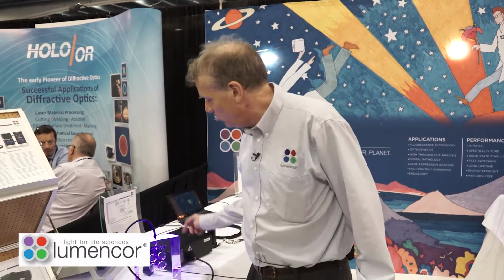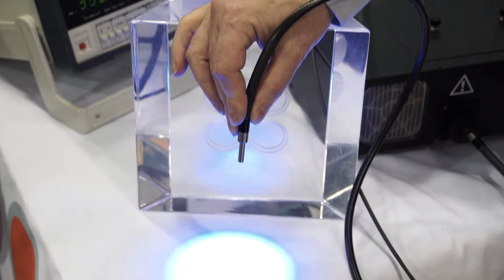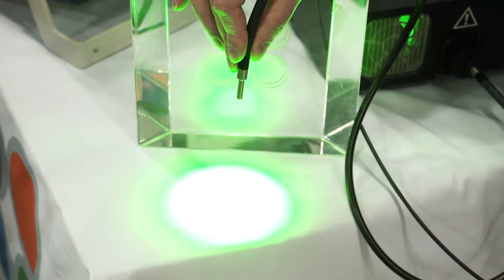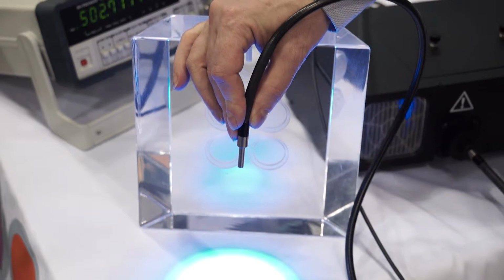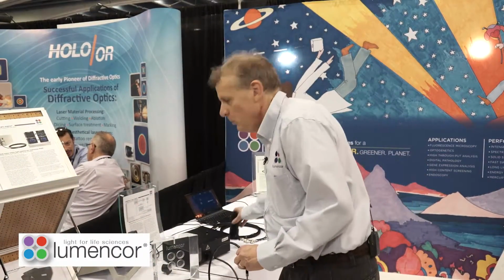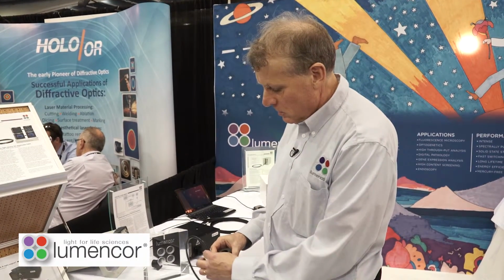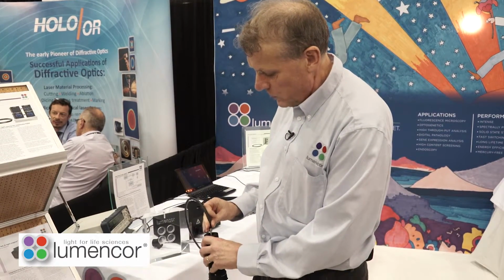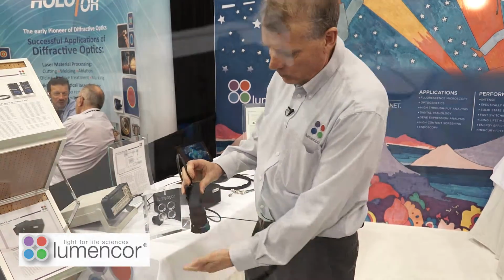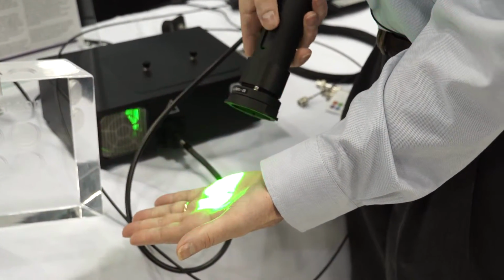The light output from the light engine comes out of here into this device, which is called a liquid light guide. The liquid light guide would take the light and eventually put it into the epi-illumination port of a microscope. To do that, we use this device here called a collimator, and the light guide would simply be inserted into the end of the collimator. The light output comes out there, and that would be directed into the microscope.